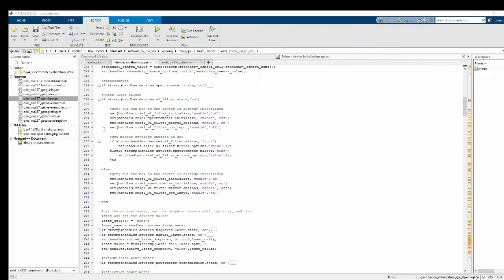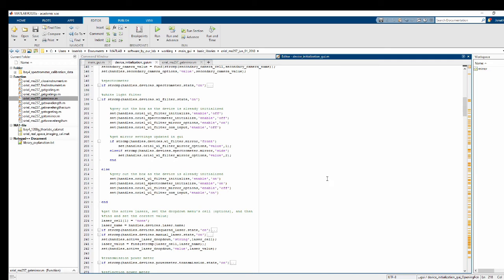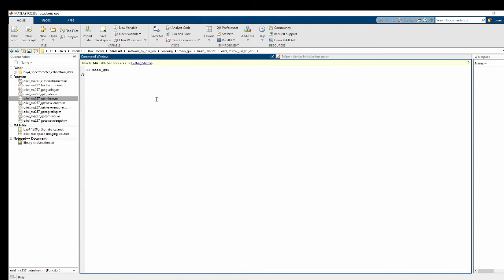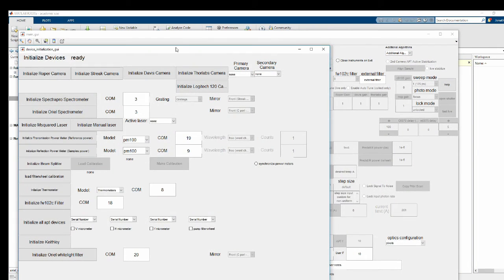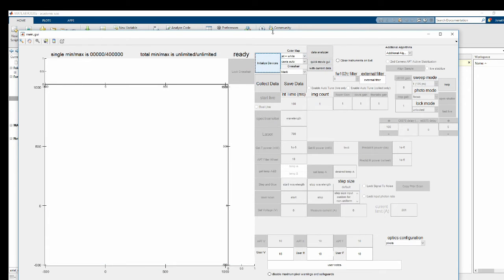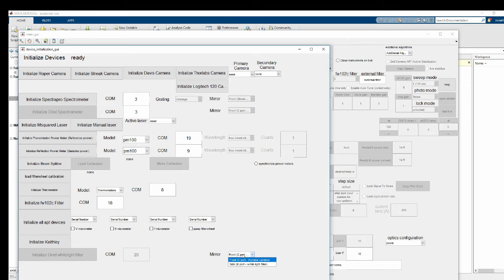Okay, so I just did an edit here because I spent a few minutes trying to find a bug. It was just a little typo problem involving what I had written in some of these here. But now it should be good to go. So now let's go test it out. All right, it set it to B port, second one, which is what it's set to in real life. Light is actually exiting the spectrometer through that port. And now if I initialize devices again, oh, it's set to C port when I turn it on. So let's go ahead and fix that.